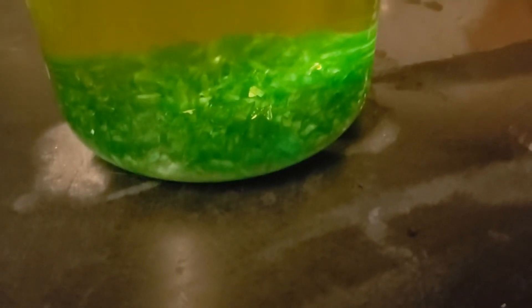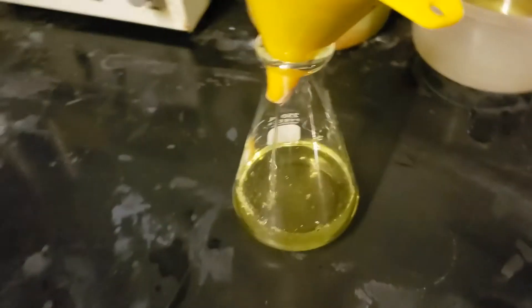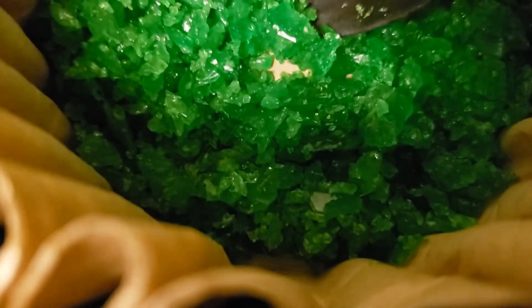The solution is chilled in a fridge overnight with foil on top and around it to protect it from light. Crystals of potassium ferrioxalate form. The potassium ferrioxalate crystals are then broken up, filtered, and washed with water. Finally, the crystals are dried in an electric heater.